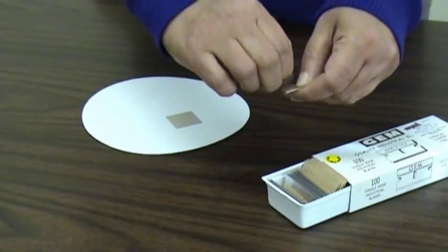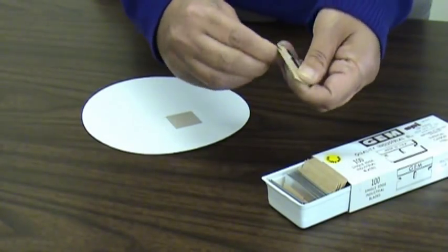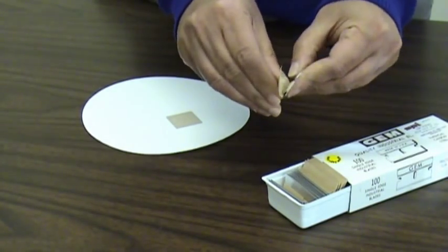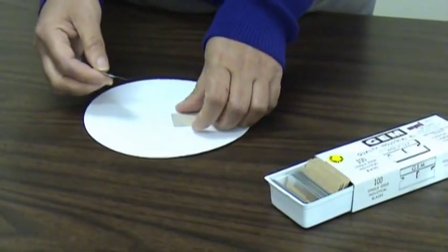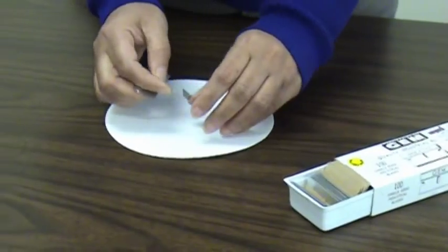By carefully using the blade edge, you can start on the edge of a mica substrate and begin cleaving on a plane through the material, slowly sliding the blade along as the planes separate.